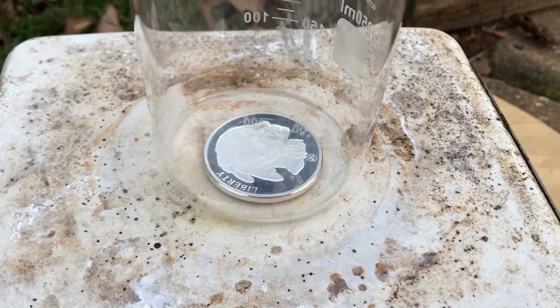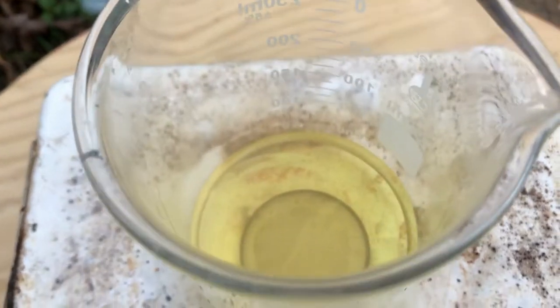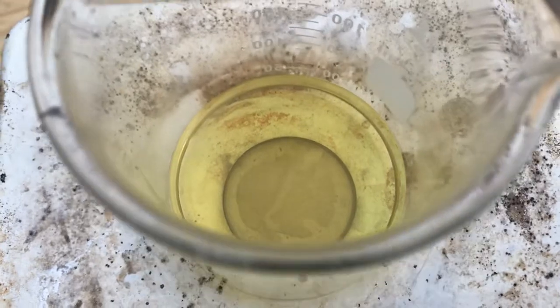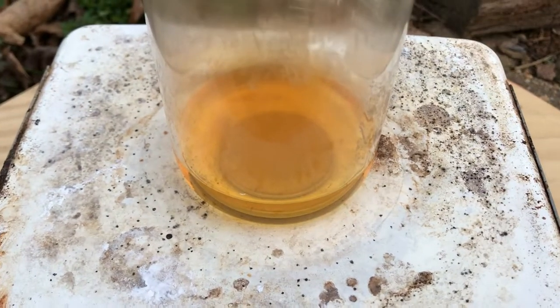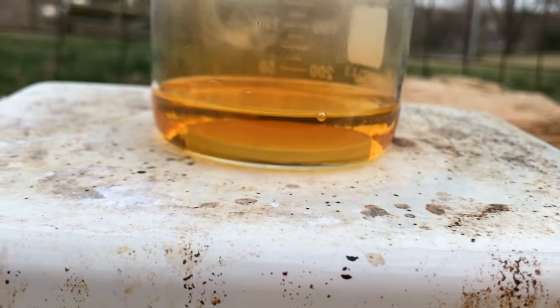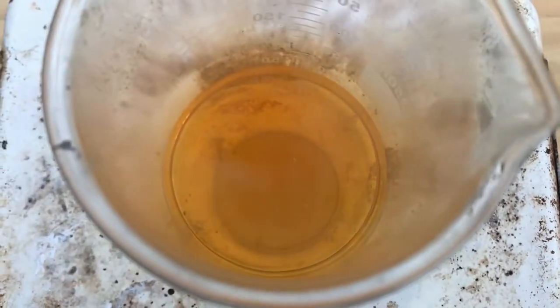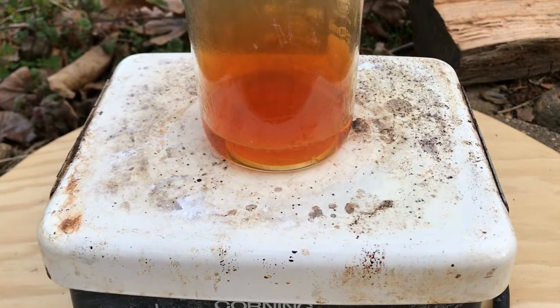First we place it in the beaker and fill it with some nitric acid. In my case, I'm using concentrated nitric acid — red fuming nitric acid — and I will have to dilute it. But for now, you can see the passivation layer that forms on top of the silver, that silver nitrate that forms. It passivizes the coin; it prevents the acid from attacking the coin through a layer of oxide.